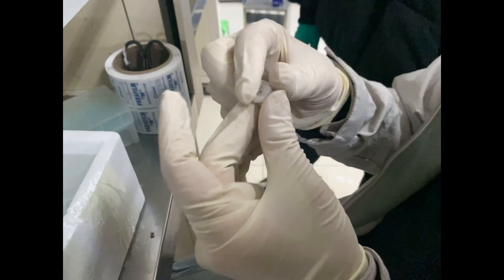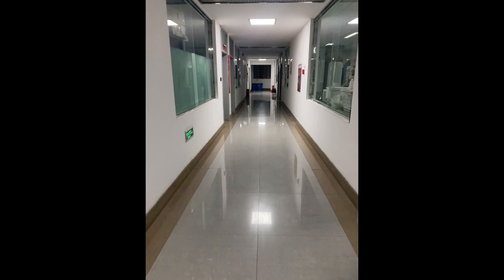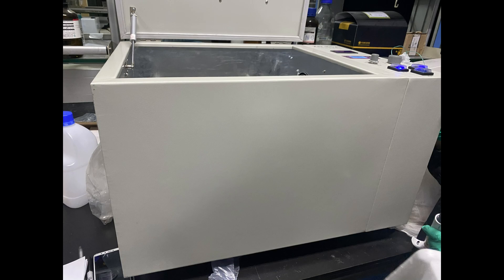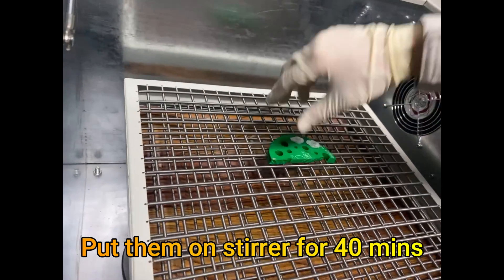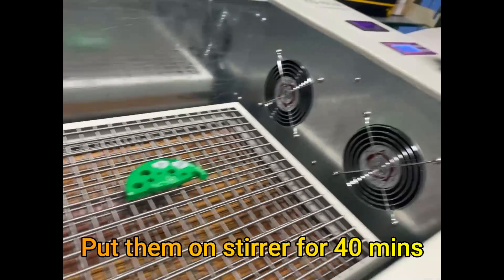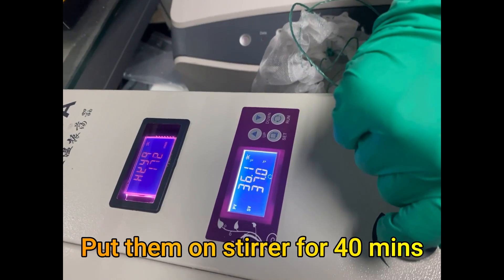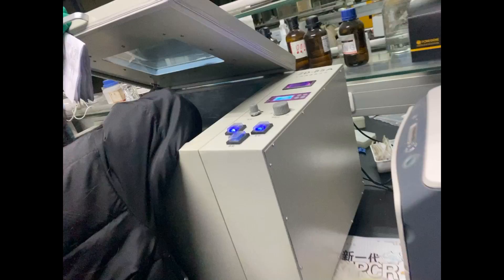Similarly we can transfer all the samples in this way, and after transferring the LB media we can seal them tightly with tape. After sealing, we need to put them on the shaker at 37 degrees Celsius. We need to incubate the PCR product and DH5 alpha on the shaker for 40 minutes, and after that we can remove and centrifuge.